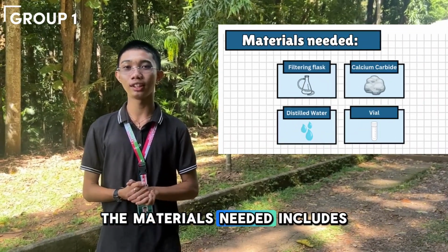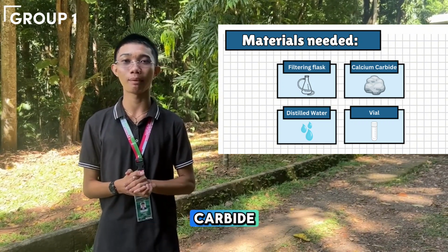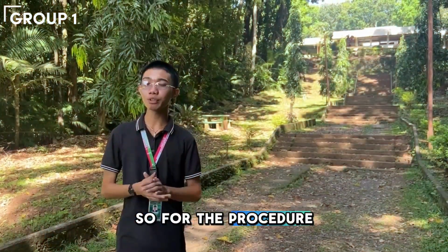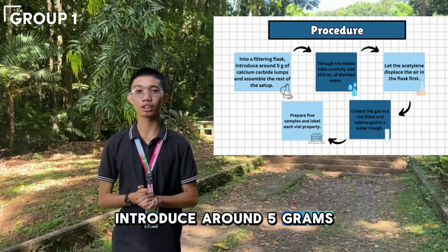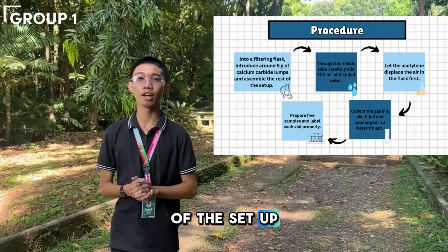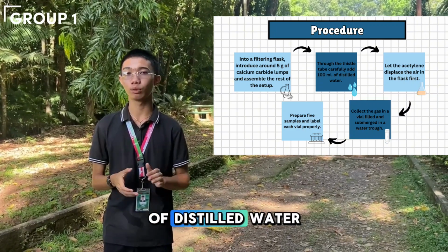The materials needed include a filtering flask, 5 grams of calcium carbide, and 100 ml of distilled water. So for the procedure, into a filtering flask, introduce around 5 grams of calcium carbide lumps and assemble the rest of the setup. Through the Thistle tube, carefully add 100 ml of distilled water.